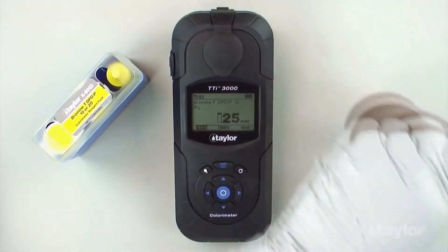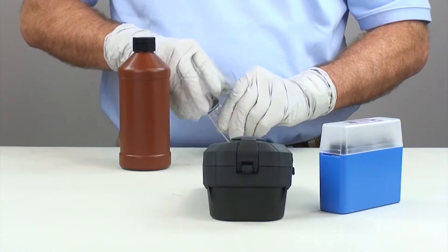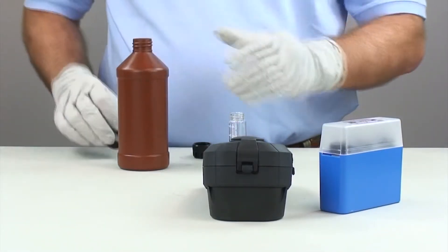In this video, we will be performing the bromine total DPD-P10 test.